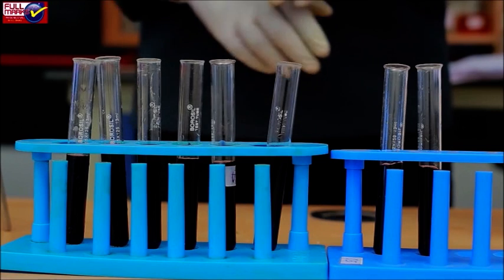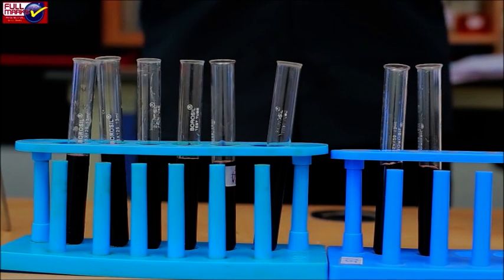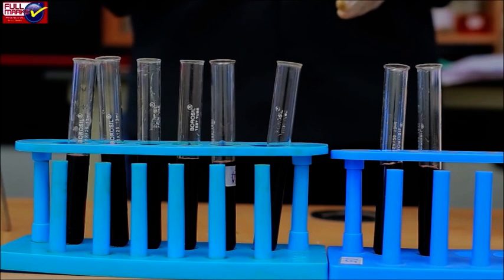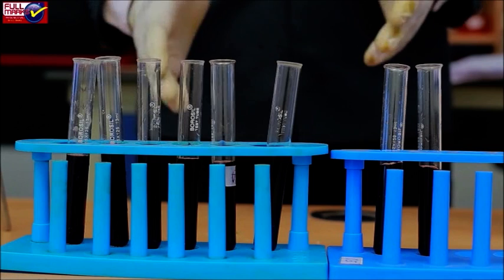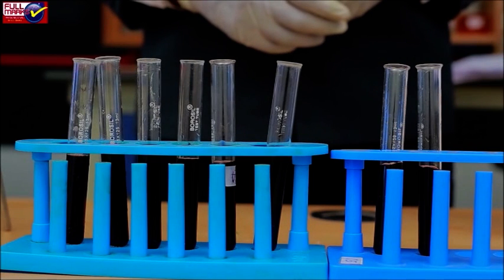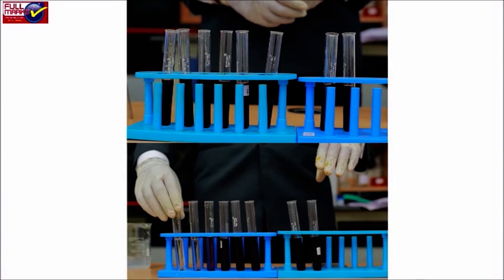Add 1 ml of diluted enzyme in all 3 experimental tubes and add 1 drop from each of these test tubes into iodine tubes. Mention the time of adding as 0 minute reading. Repeat this process after every 2 minutes till iodine color does not change. Record the observations of every experimental setup.